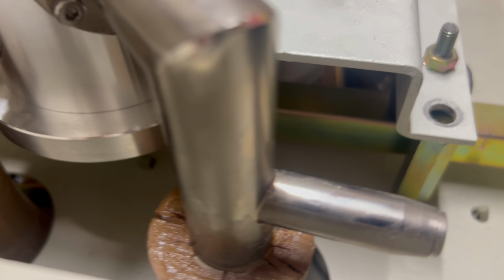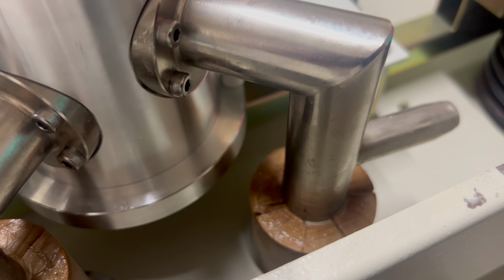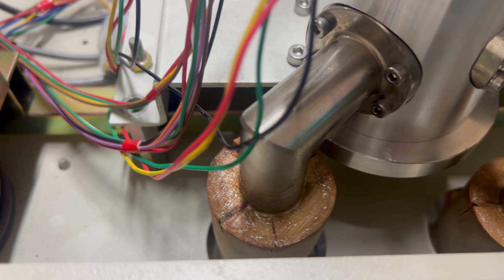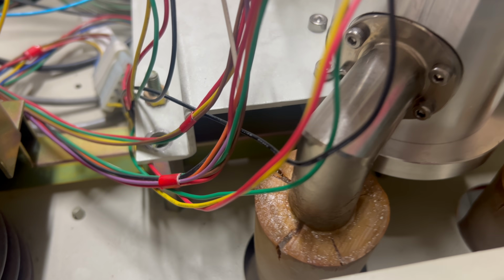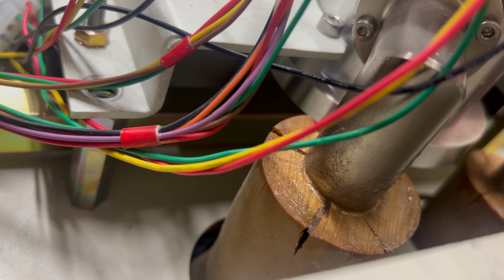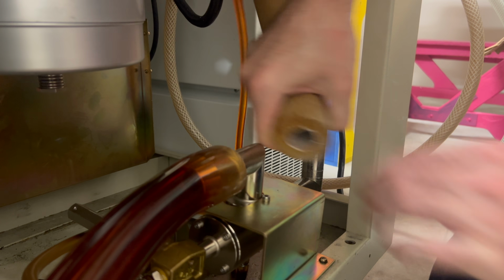I took a closer look at the connections and yeah, holy cow. These 30-year-old rubber hoses are not looking too good. They have deep cracks almost all the way through. I don't know for sure if they are leaking yet, but even if they somehow are not leaking, if they suddenly fail while the diffusion pump is running and expose the pump to atmosphere, that's not a good day. These definitely have to be replaced.